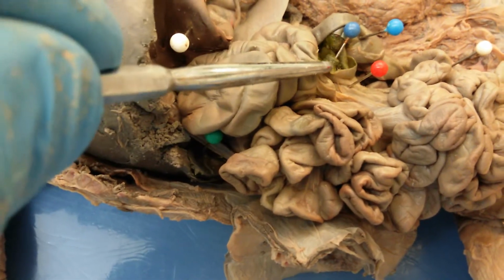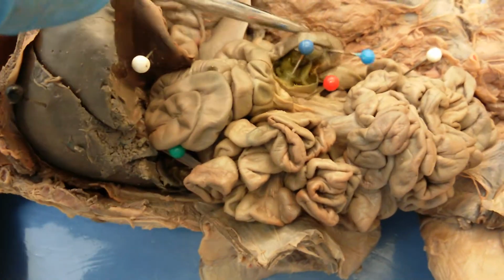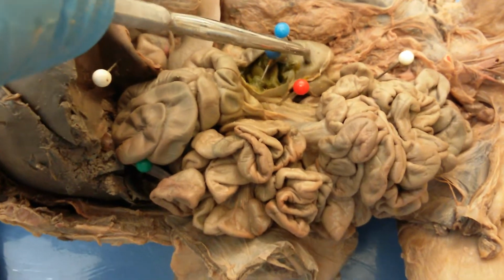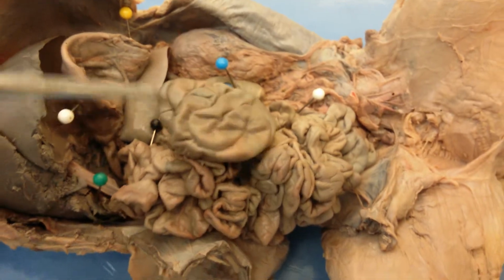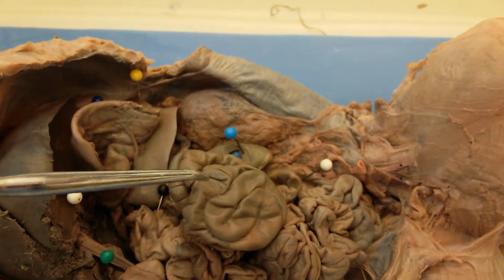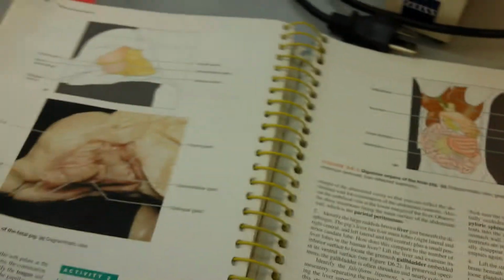And then through this ileocecal valve, food actually gets into the cecum. So this is the cecum. It looks kind of like a little sock or pocket. This is the beginning of the large intestine, and then this right here is the rest of the large intestine, which in the pig is called the spiral colon, and this is very different from the ascending, transverse, and descending colons in the human. So in the human, we actually going to look at this.